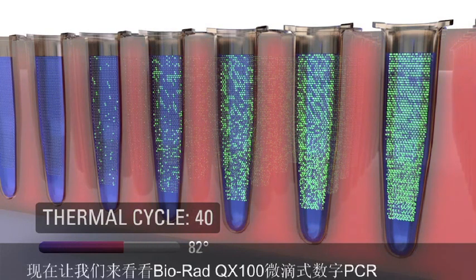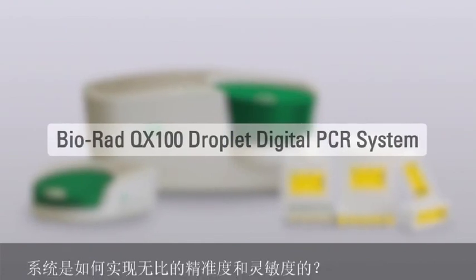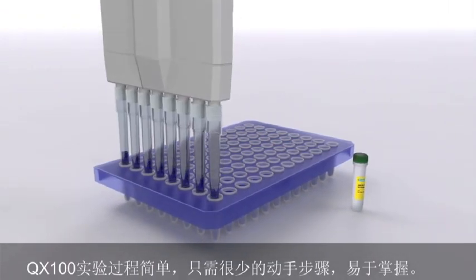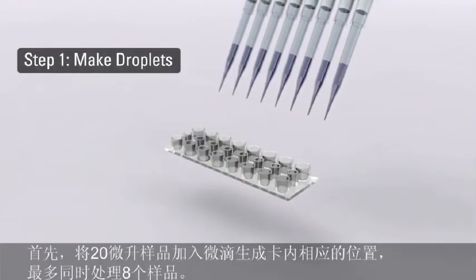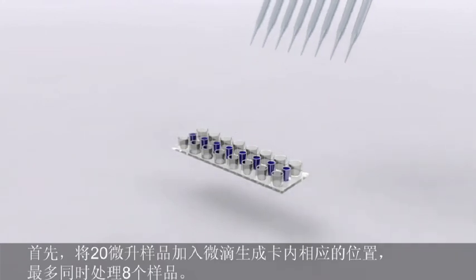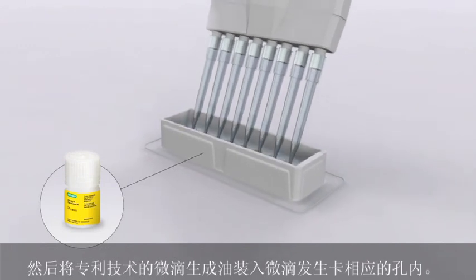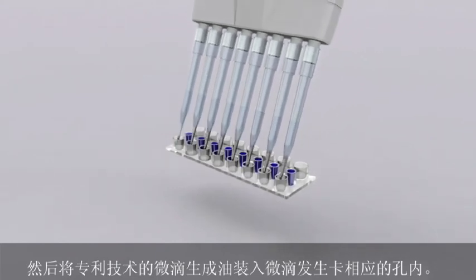Now let's look at how the Bio-Rad QX100 droplet digital PCR system performs digital PCR with unrivaled precision and sensitivity. The QX100 system uses a simple workflow that requires minimum hands-on time and procedures that are easy to perform. First, 20 microliters each of 8 prepared samples are transferred to the droplet generation cartridge. Droplet generation oil is then loaded into the corresponding channels of the cartridge. There are 8 oil channels, 1 for each of the samples.